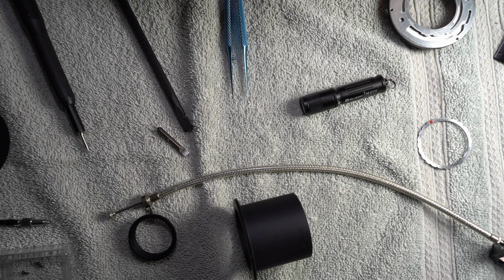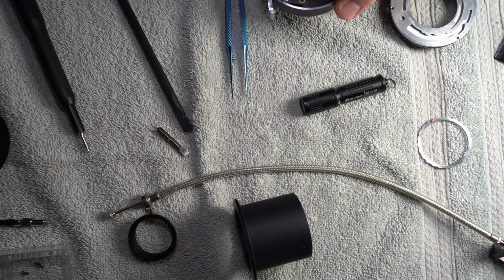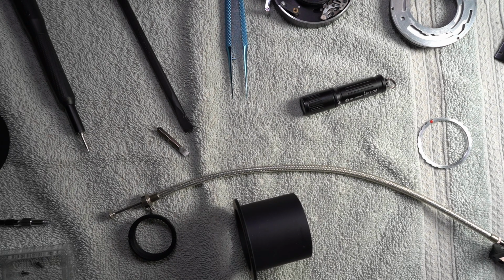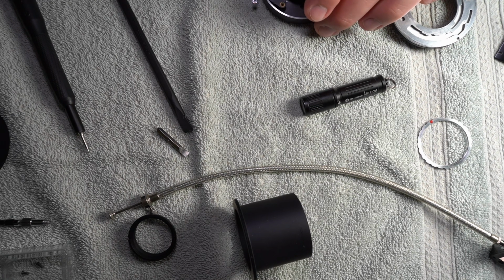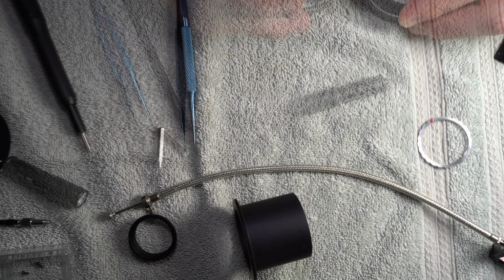Now that I'm putting grease on it, I probably should have put oil on it. It doesn't really matter at this point, I don't think, because this is basically open to the elements where that is, and I don't think anything you put there, short of graphite or something, is going to be totally safe for the thing. I'm never going to wipe the excess off of that. It's going to figure itself out. There we go. Okay.